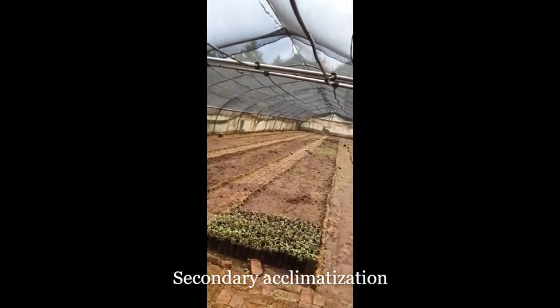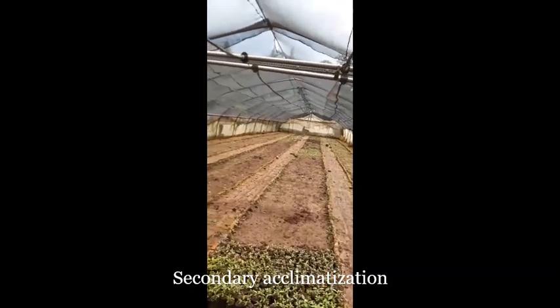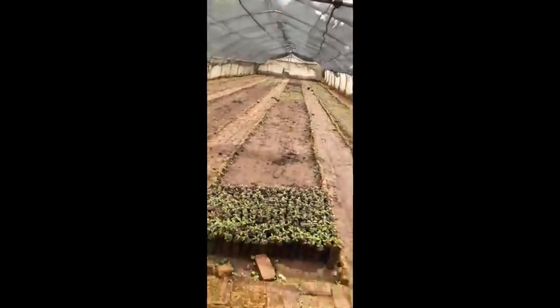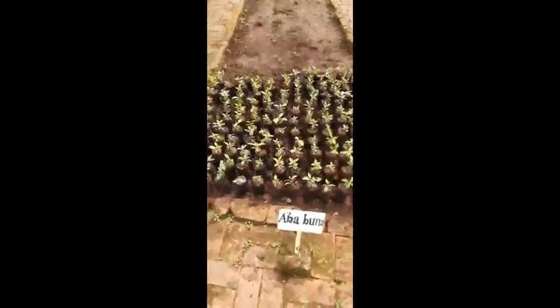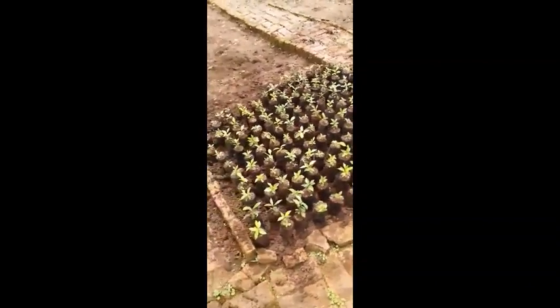This is a greenhouse, but it is not a modern greenhouse. This is a net house. These net houses are used for secondary acclimatization of coffee. After secondary acclimatization, those coffee seedlings will be good and easily distributed to our farmers.